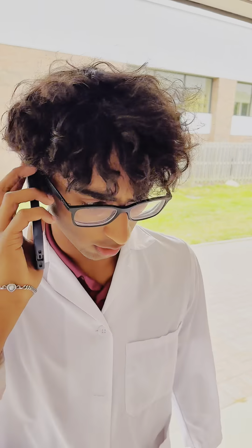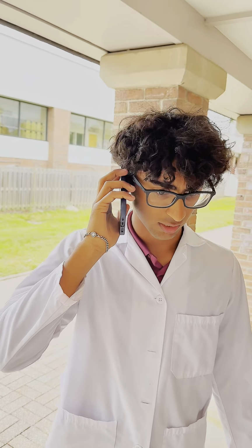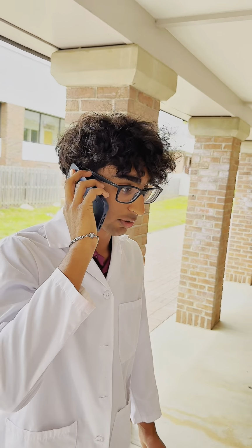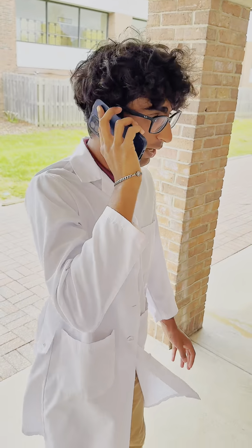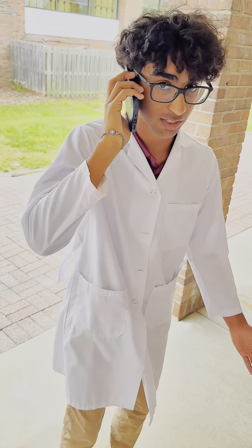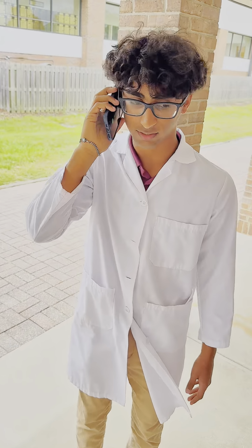Alright, well, before you get started, you need to know a couple things. Titration is a controlled addition and measurement of the amount of a solution of known concentration required to react completely with a solution of unknown concentration. Because acids and bases react, the progressive addition of an acid to a base or base to an acid can be used to compare the concentrations of the acid and the base.